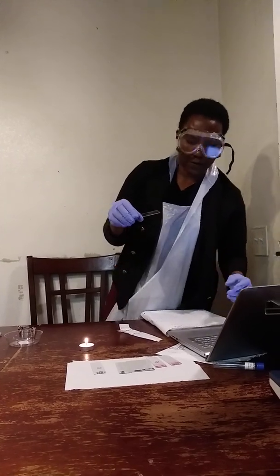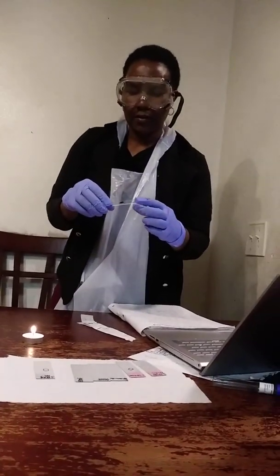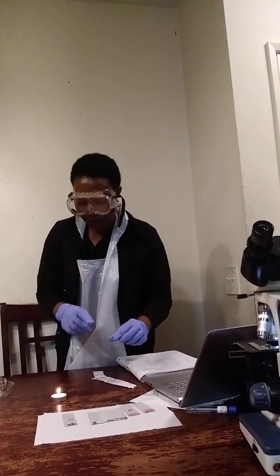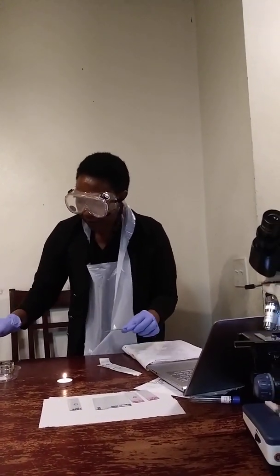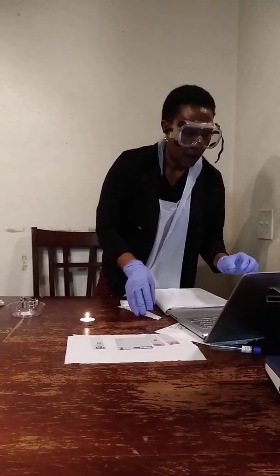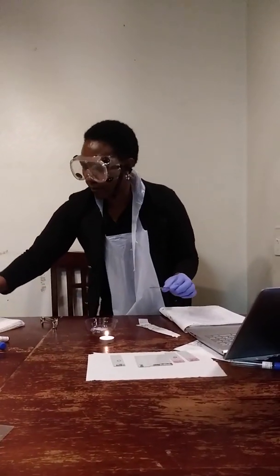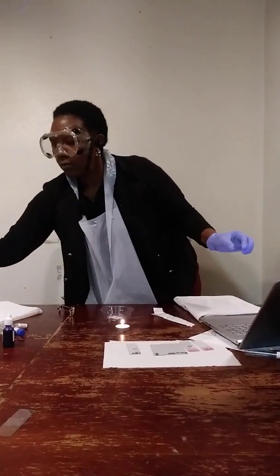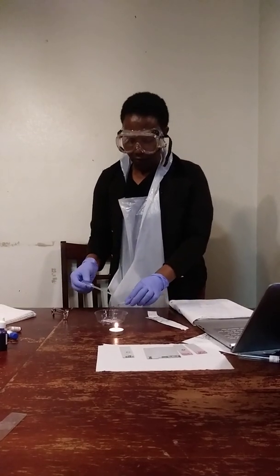Coming back from my first direct culture that I took from my mouth, and then I poured the crystal violet. I'm going to rinse it off with some water.